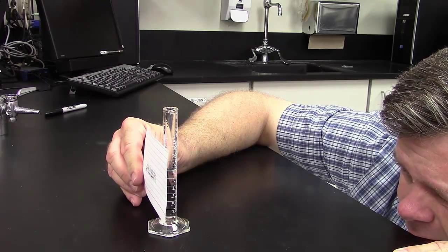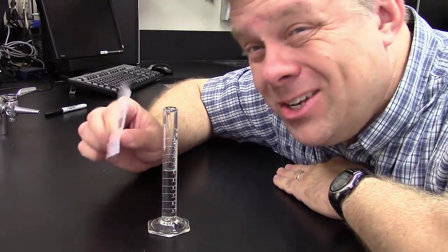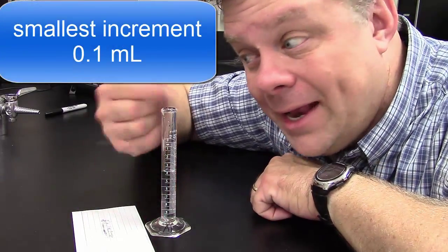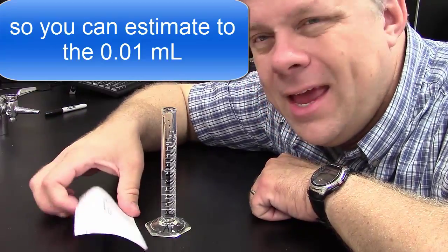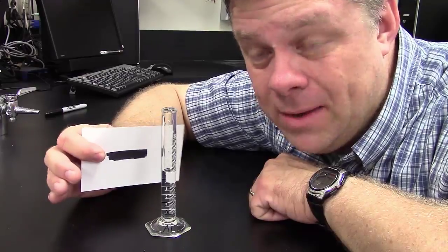6.13 milliliters. Now remember, I can do that because the smallest increment on the 10 milliliter one is to the tenth of a milliliter. That way I can estimate one more place, or to a tenth of the smallest increment. That would be 6.13 milliliters. Okay? Now you really need this little trick. It helps tremendously to get the right measurements.